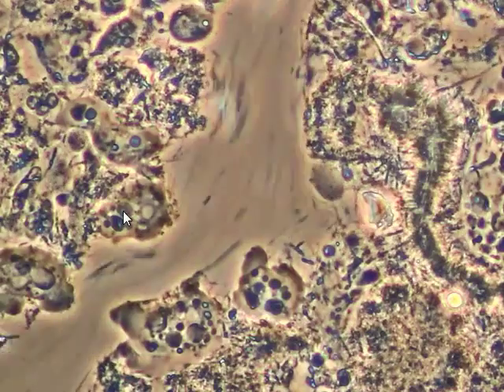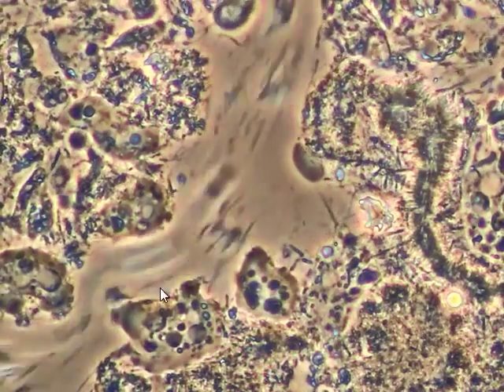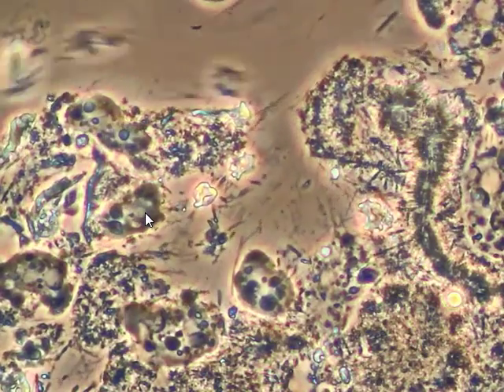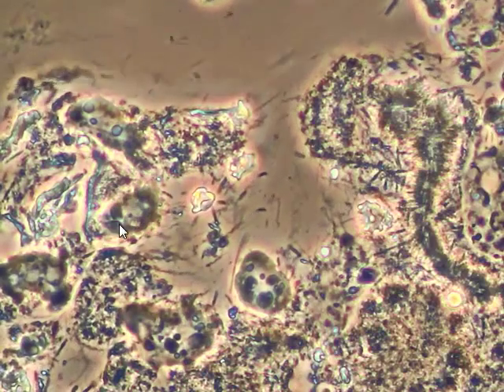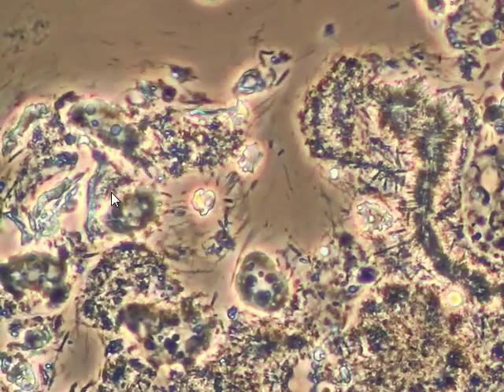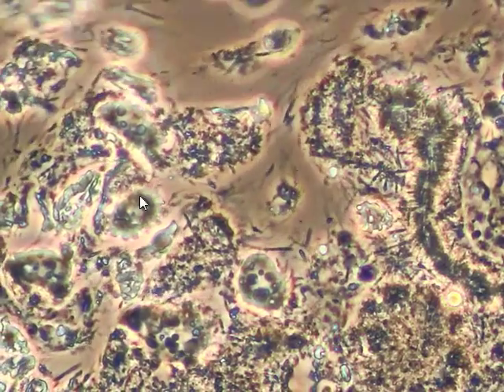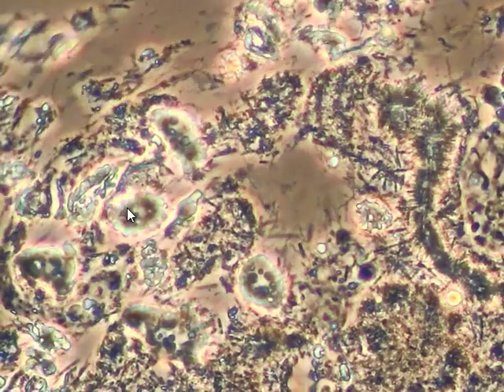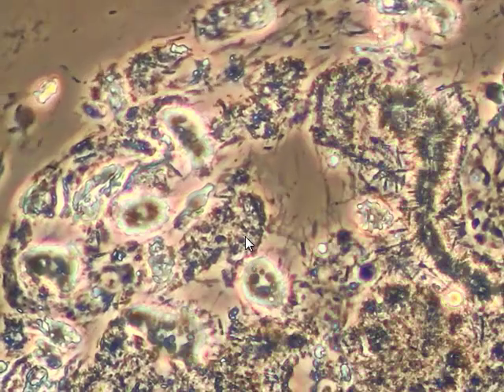And you'll start seeing the effects of the salt on these cells. You'll start seeing them shrinking, and the salt starting to penetrate into these amoeba and protozoa along the edge here. They're starting to shrink now, and you can see the salt effect coming into this area. These cells are being shrunken down and killed within a matter of seconds as soon as the salt has hit this spot.